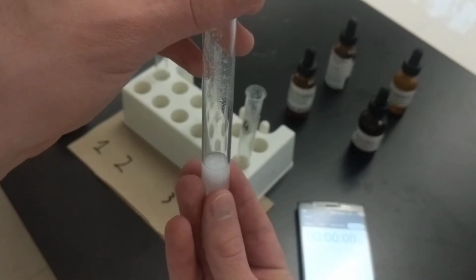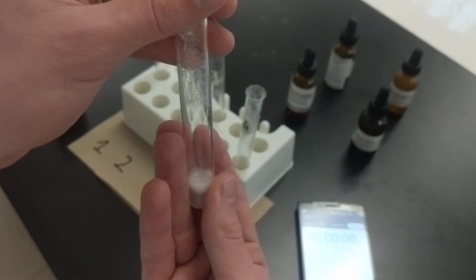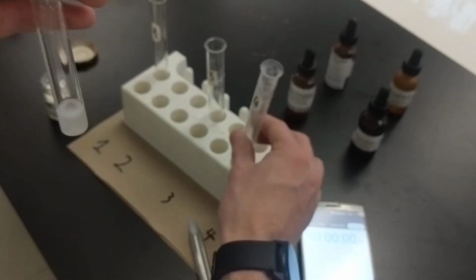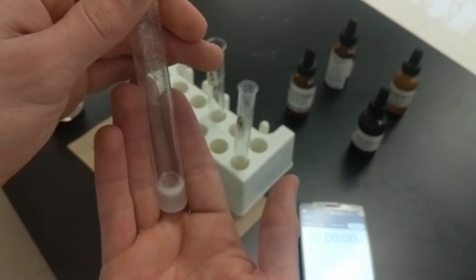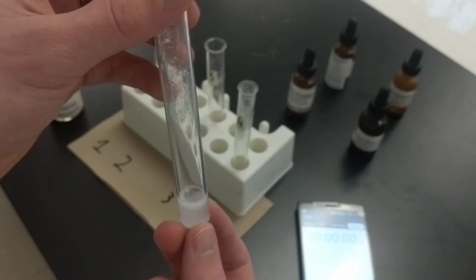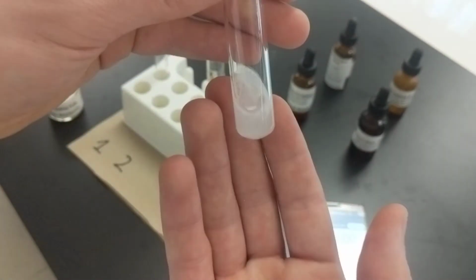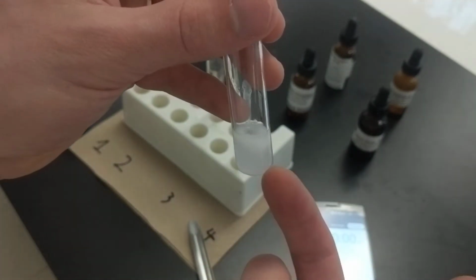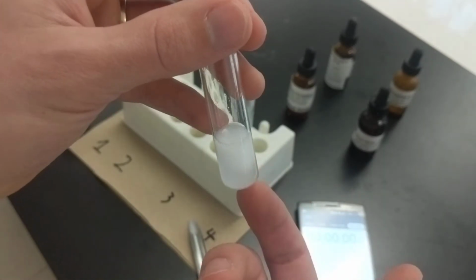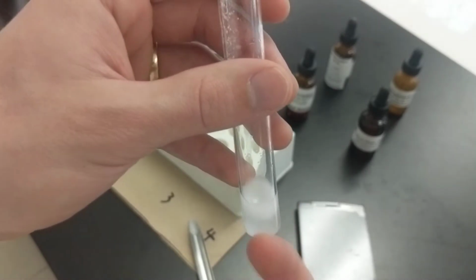Now I can't feel the temperature change. Oh, actually, I think that feels colder. Maybe not. That might not be any colder. Okay, but anywho, you can hopefully see that there were a lot of bubbles that happened there. If I swirl it, there might be a little bit more, but not much. At this point, all of the vinegar has pretty much reacted. Still bubbling, but not much. And then at some point here, it's going to be all done.